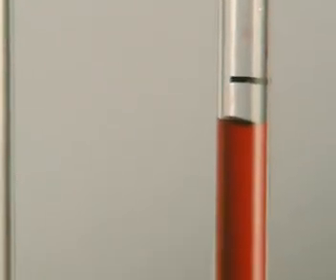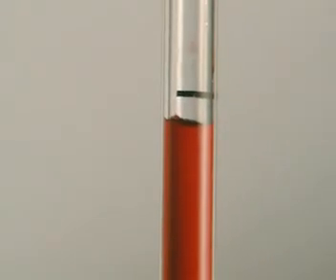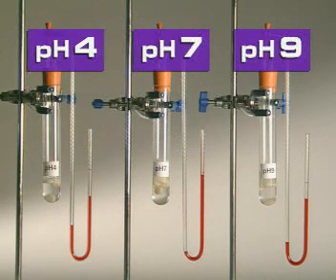The time it takes for the fluid to rise a set distance is recorded. At what pH does catalase work best?